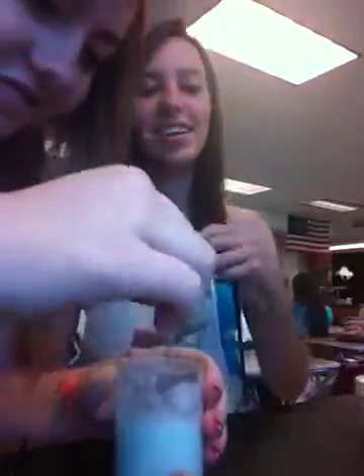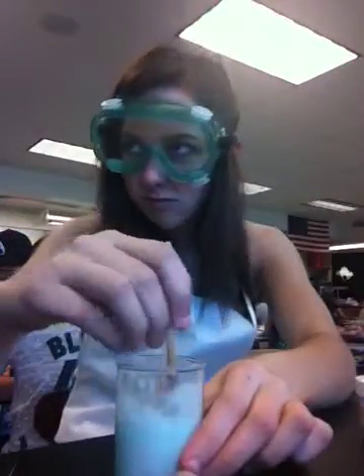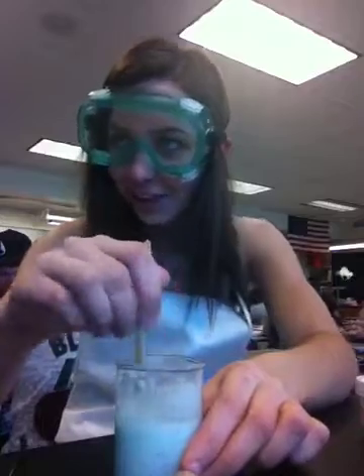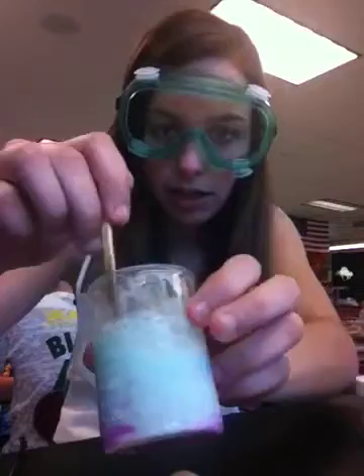Oh my god. Look at that. Put your goggles on, Sabrina. I know, it's ringing. Goggles have been working over here. Just stare into the TV. Oh my god, look at it. It's turning pink.